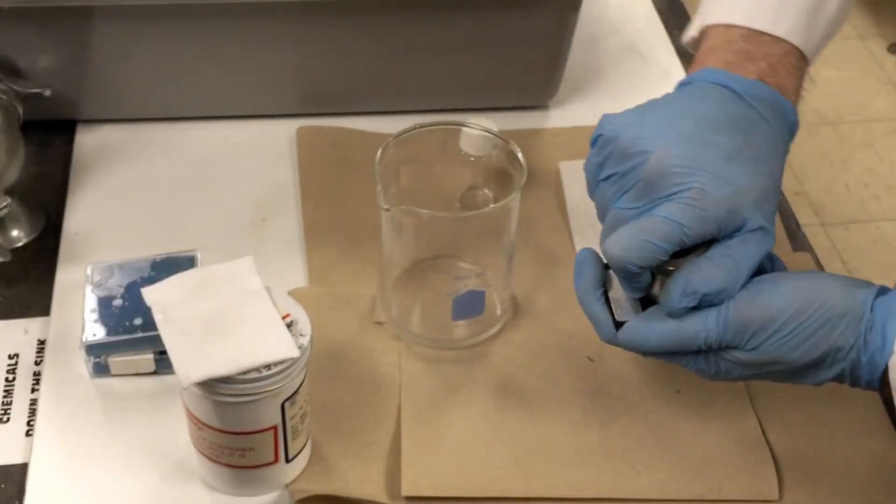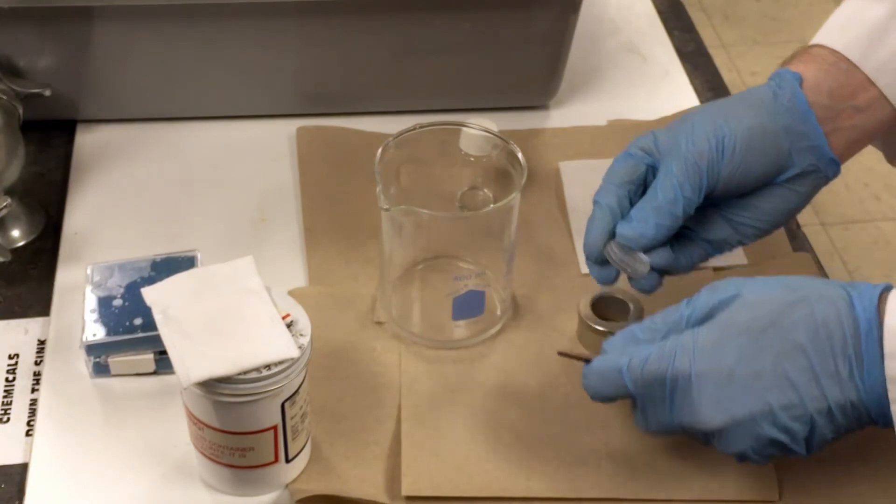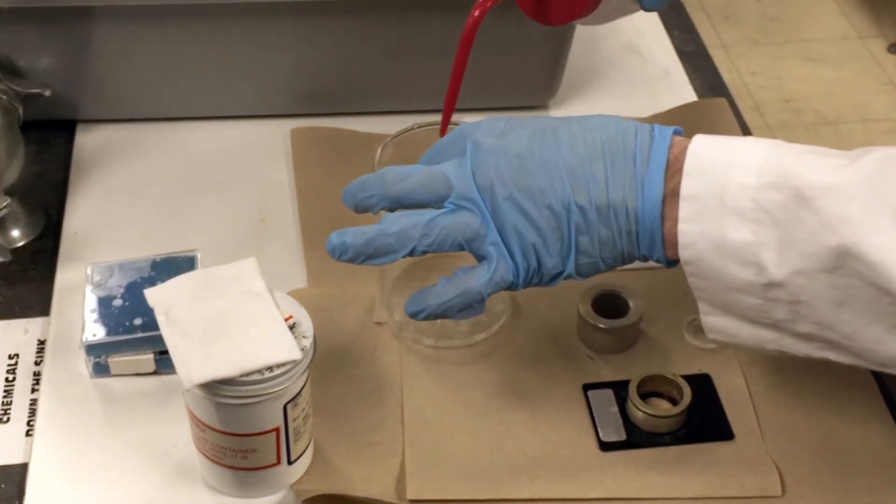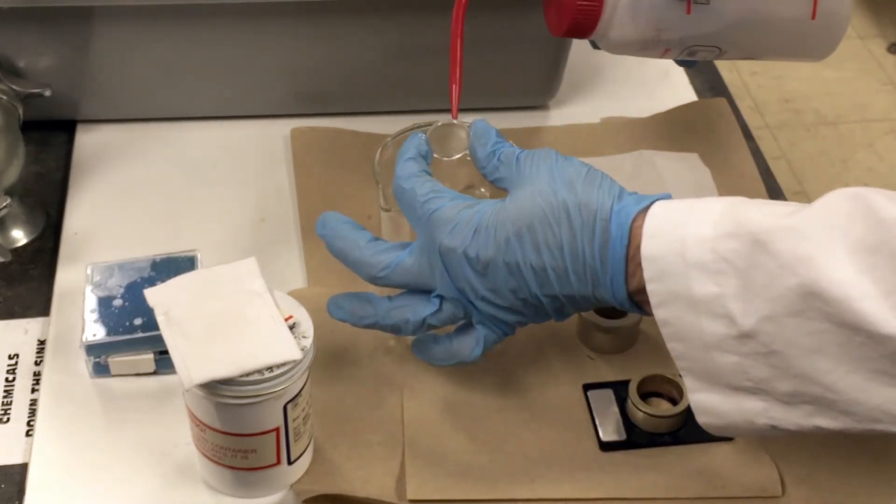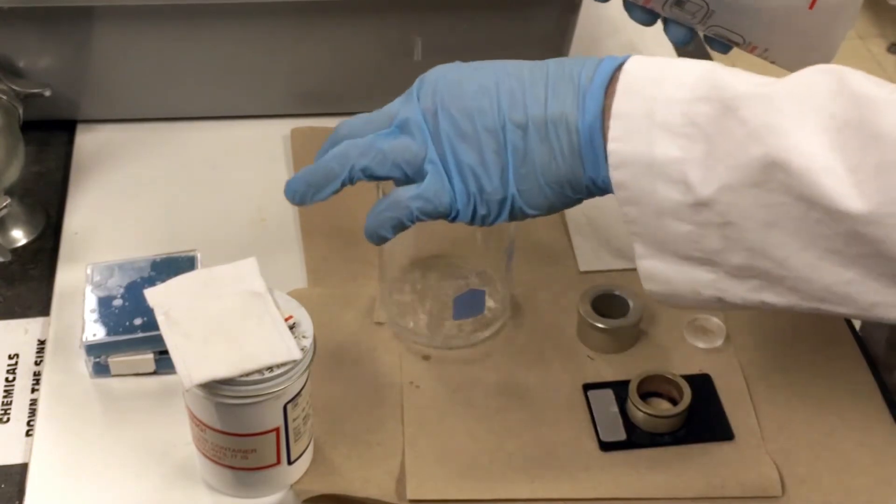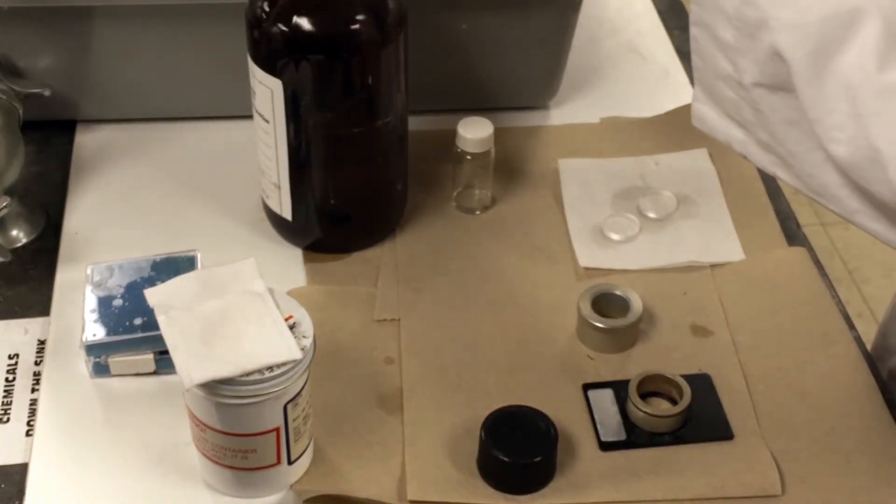Now that the spectrum is done, it's time to clean up. Rinse both salt plates thoroughly with acetone. Discard the acetone wash into an appropriate waste container.